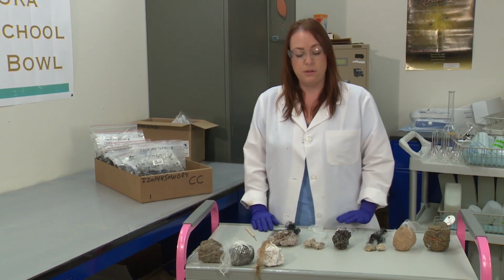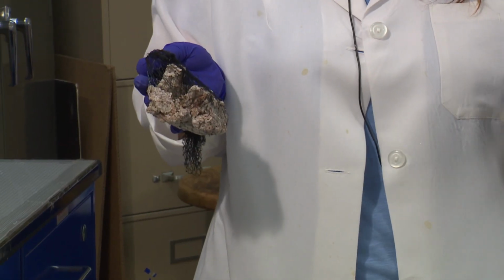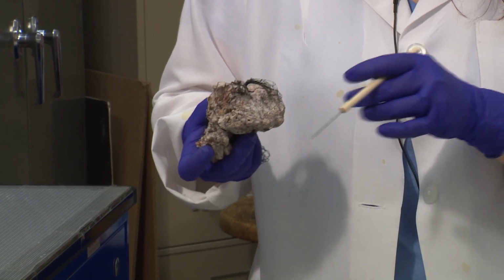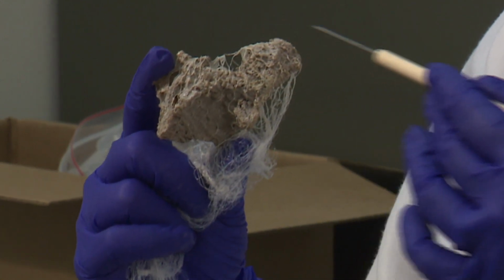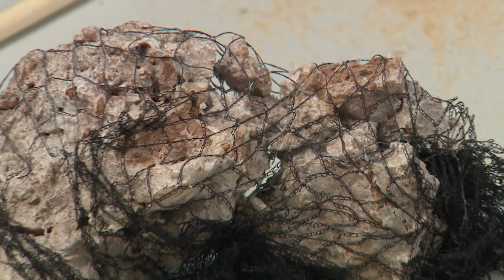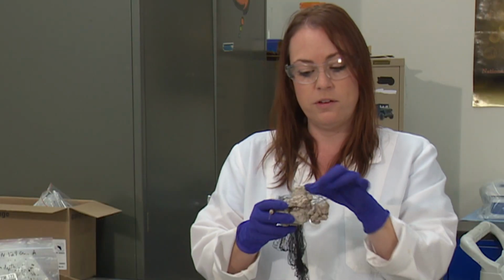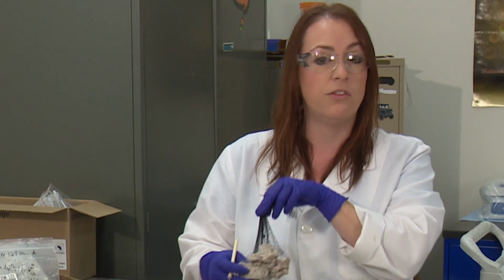Some of the clod samples that we get in that do not give us good data. Here's an example of a clod that is crumbly, and as you can see, the saran here will get stuck in these little air spaces, air pockets inside this clod, and when we put it onto the table, the water isn't free to absorb up into the clod. And of course, these pieces we can't use anyways, and if we break these pieces apart, the clod wouldn't be big enough to use.